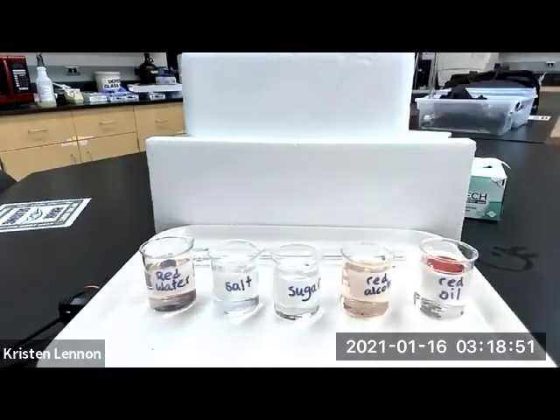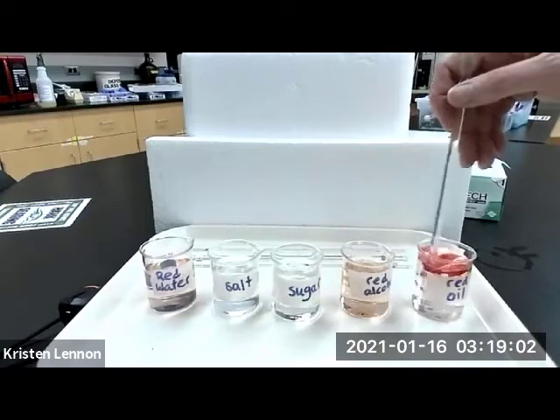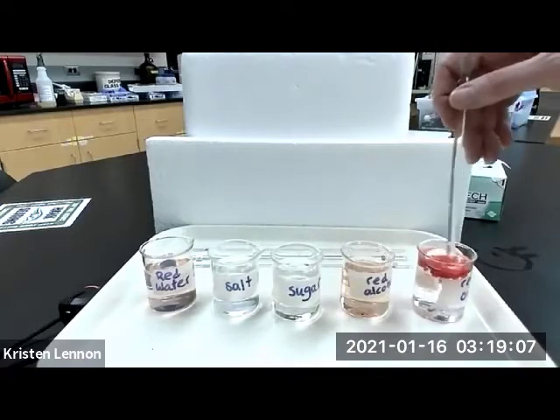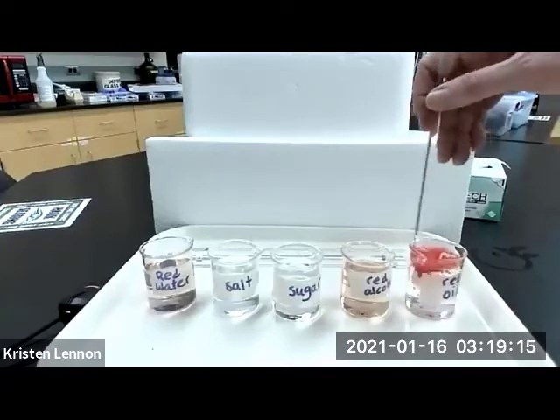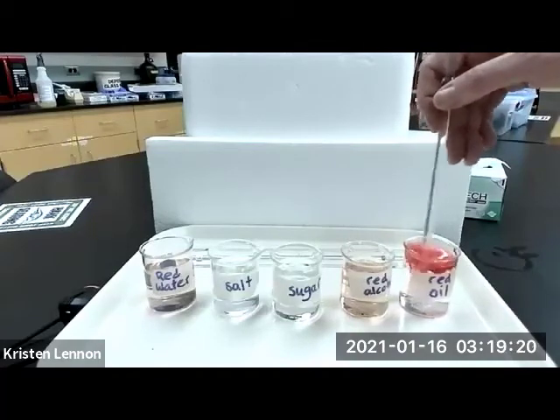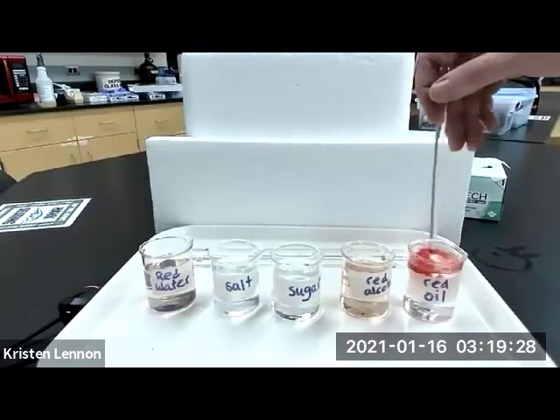And last, we have the red mineral oil with our stir rod labeled E.